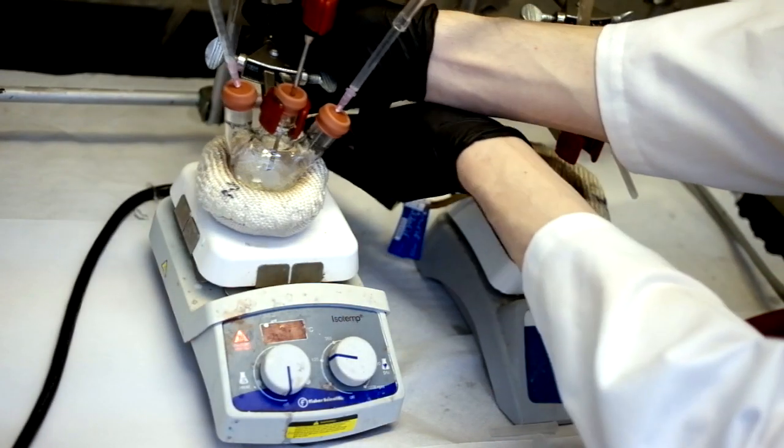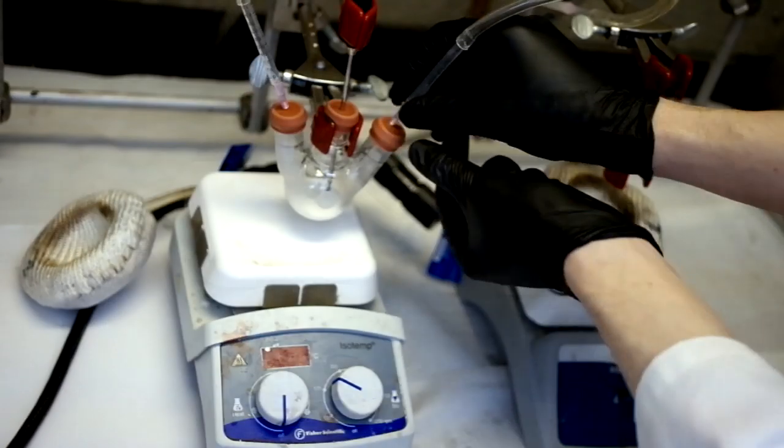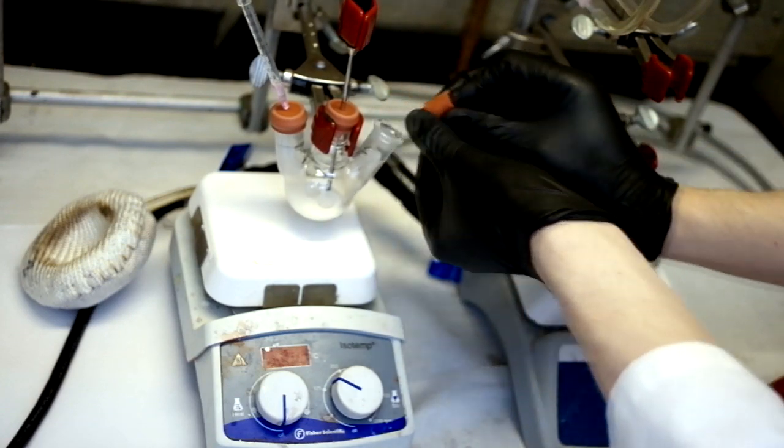Once your material in the reaction flask has turned clear, allow it to cool to room temperature. Once it has cooled to room temperature and re-solidified, stop the argon flow and remove one septum.